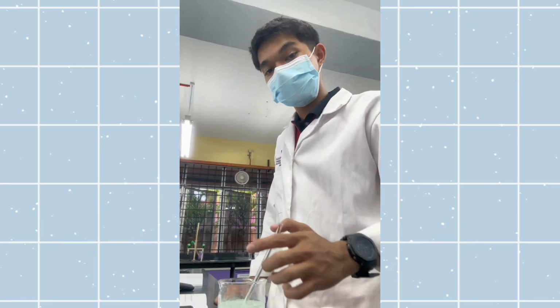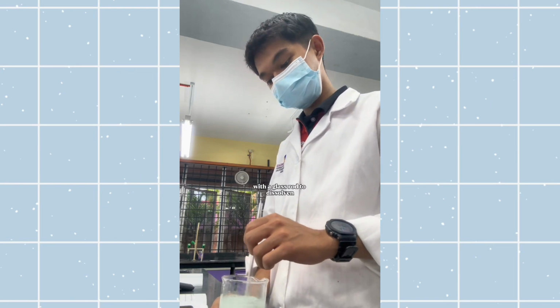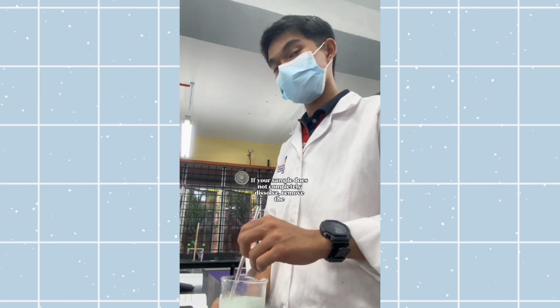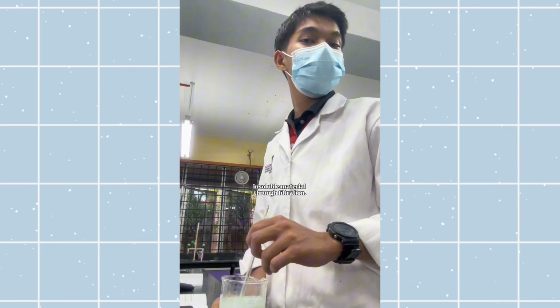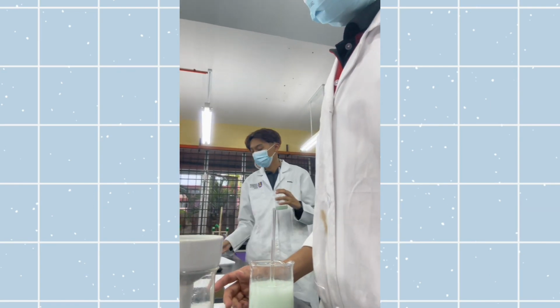Number 1, obtain your plant food sample and record the set of numbers written on the label. Number 2, weigh the plant food sample between 3 to 3.5 grams using a weighing paper and transfer the sample to a 250 ml beaker. And number 3, add 35 to 40 ml of distilled water and stir the mixture with a glass rod to dissolve the sample. If your sample does not completely dissolve, remove the insoluble material through filtration.